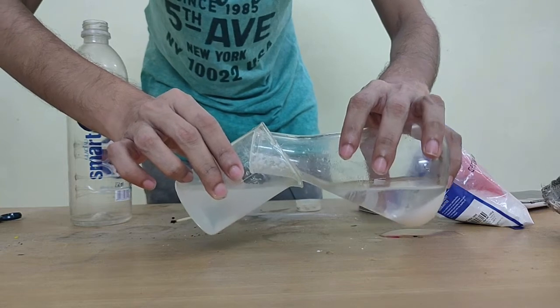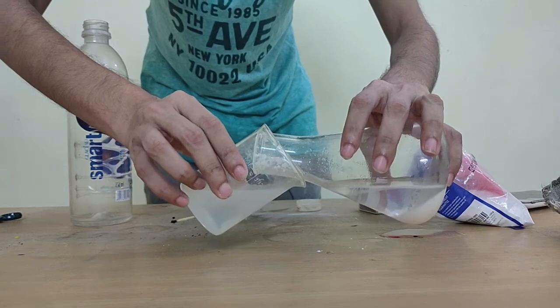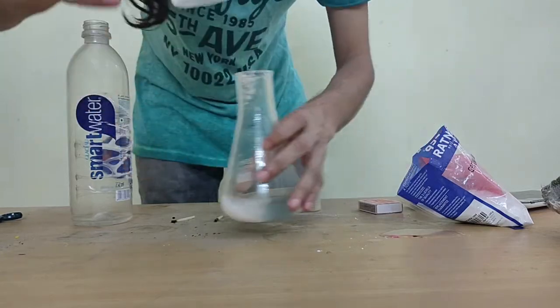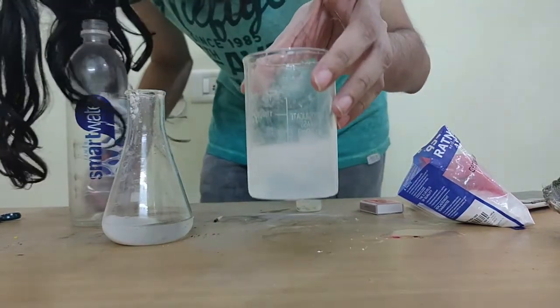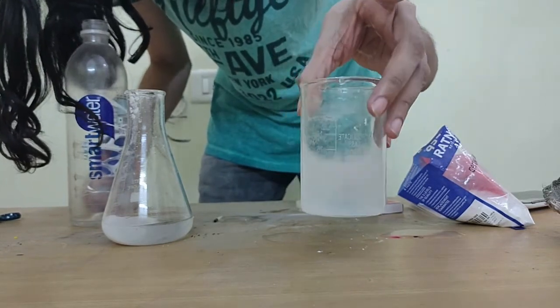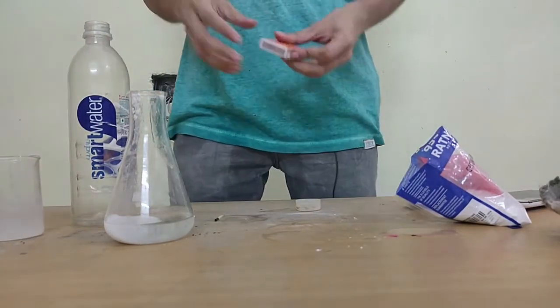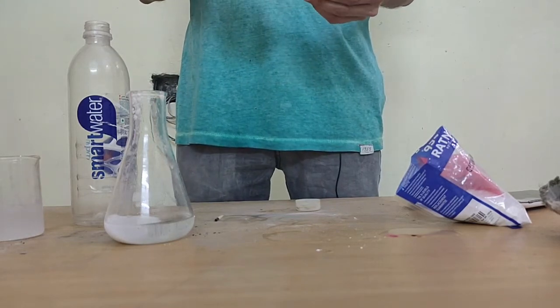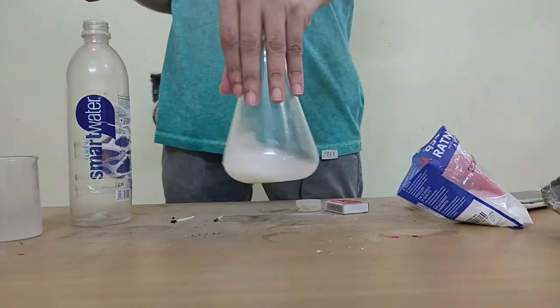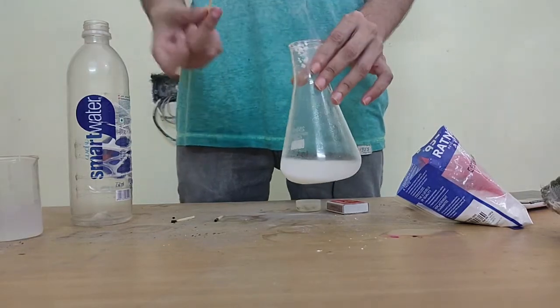I'm just trying to see if there's any more carbon dioxide that is going to make it milky, so it's a little more clear for us to see. It's quite interesting, exciting for me. I don't see much difference, but yeah, now you'll see it has gone a little milky, right? Awesome. I'm glad this was able to happen today. And the final test, it might not work because there's only a slight amount of CO2 left inside, but I'll still try to do the flame test.